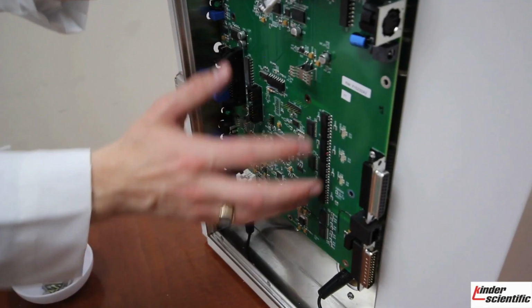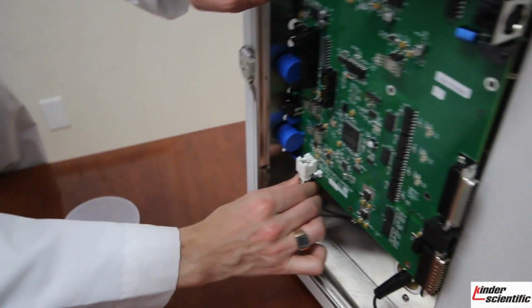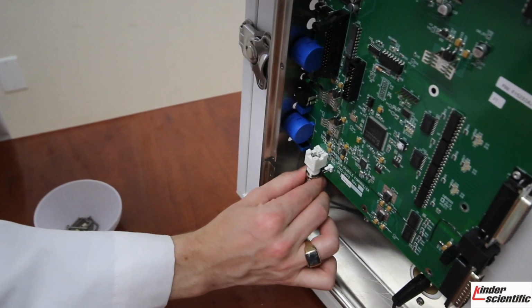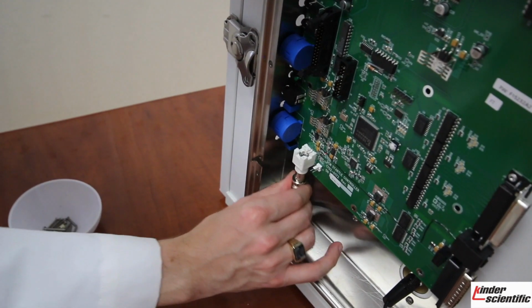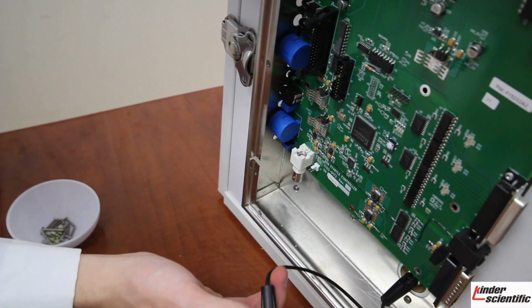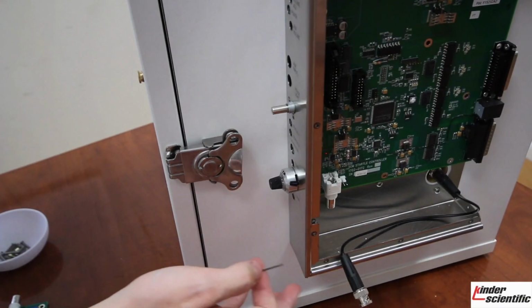While removing the screws on the board, remember to unplug this BNC cable. You will do that by just rotating it until you hear the click. It will spin off, and then you can just slowly pull it down, and then it is removed from the board.